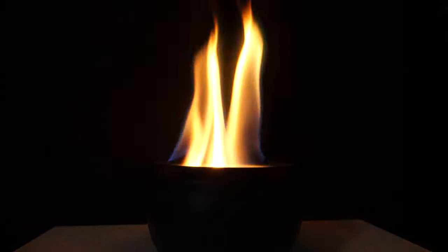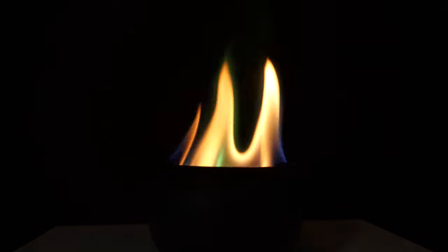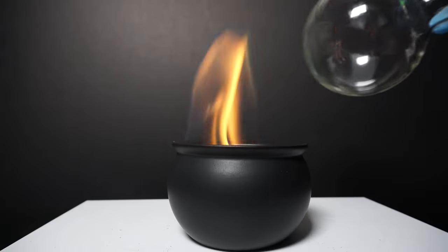Putting it out is relatively easy as well and all you have to do is smother the flame and to do this I just use a round bottom flask and it goes out right away.